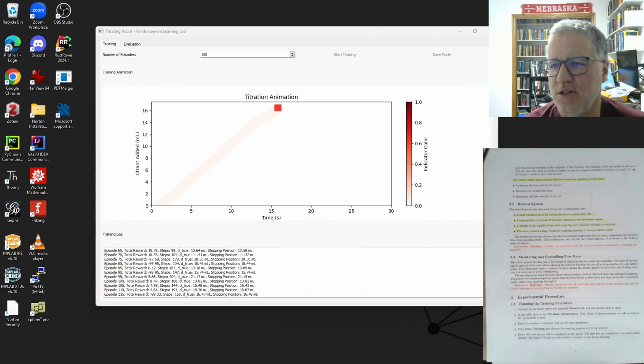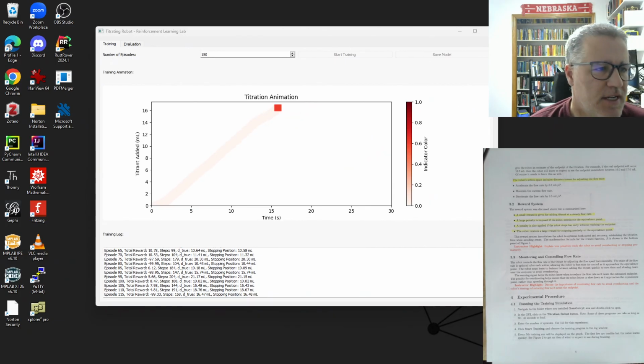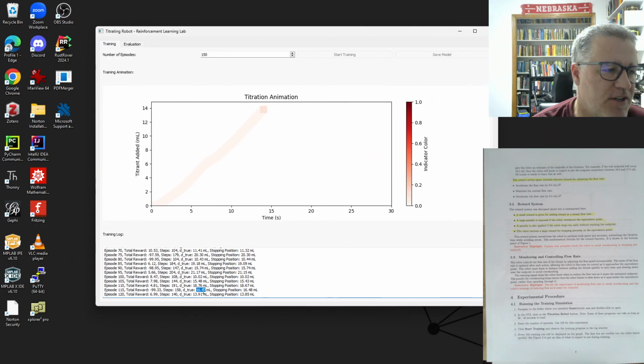Okay, come back a little early. It's getting some really nice runs here. Oh, here's a good example. We just went a bit too far. See, 16.48, and it was supposed to be the true value is 16.47. So then we got a reward of minus 99. So we hit that minus 100 came in.